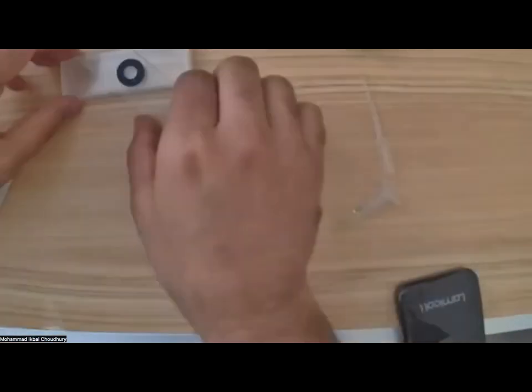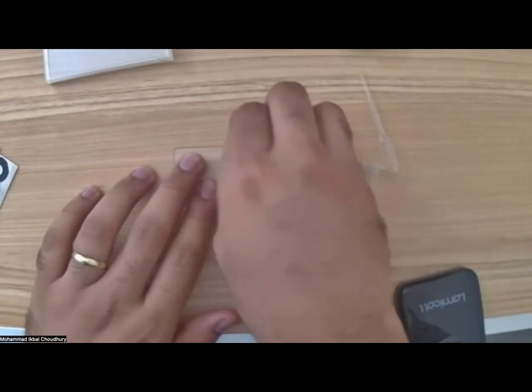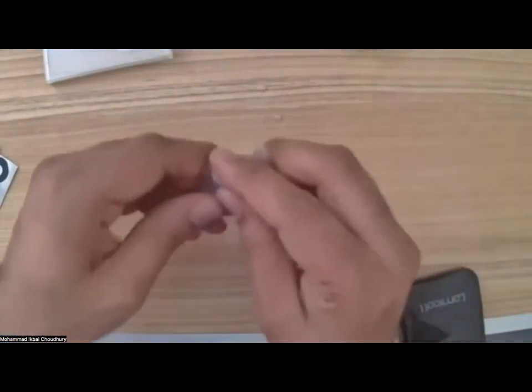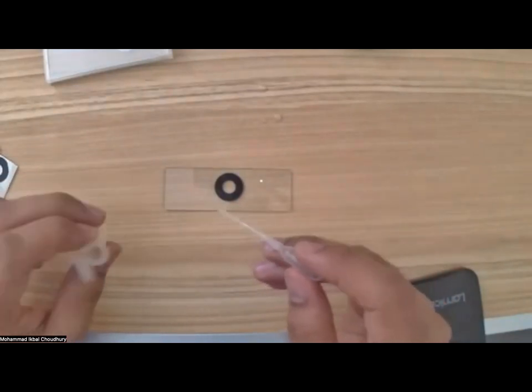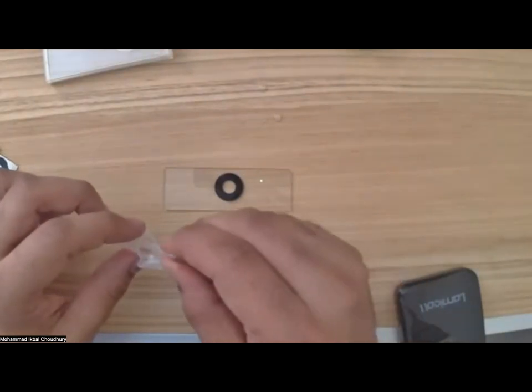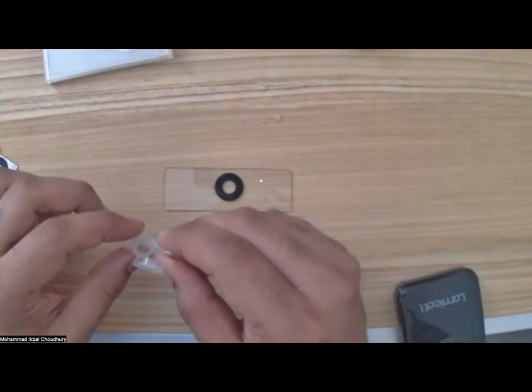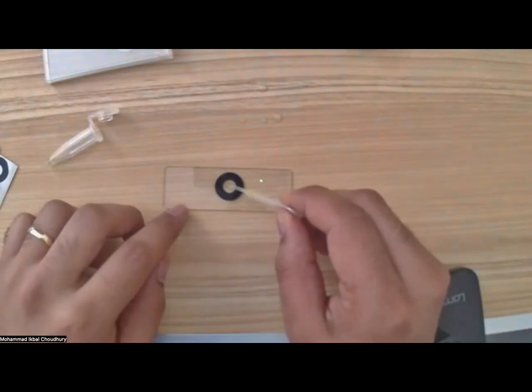So you can take the ring sticker or the slide that you want to prepare, remove the plastic cover, and put it back somewhere safe. And now let me see if you all can see what I'm doing. While looking at the screen, I can't really align my hands. Okay. I'm trying to pick up as many large particles as possible, because this is going to be really tiny algae that I can't guarantee we can visualize.